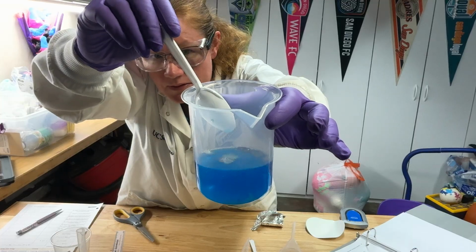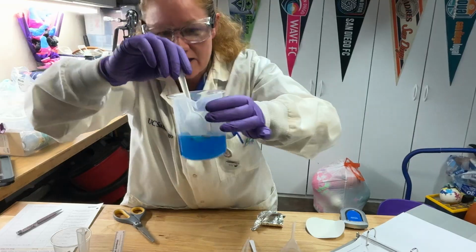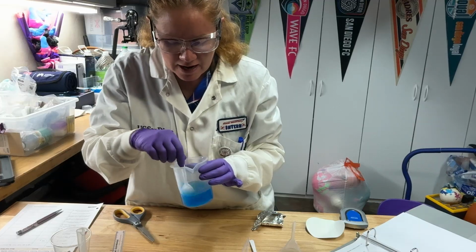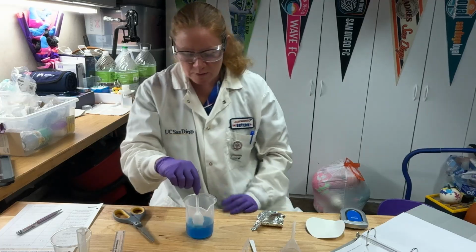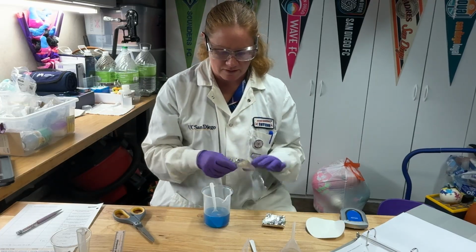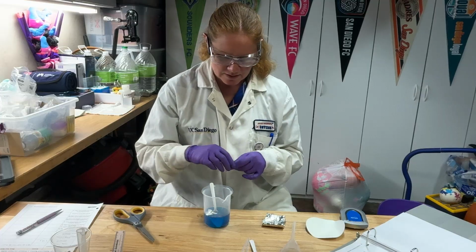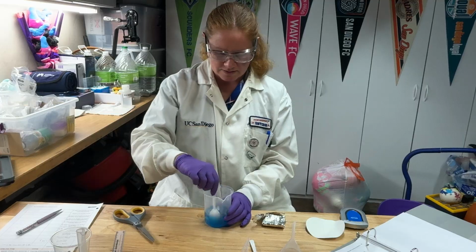So maybe you can see there. You're starting to get a little bit of bubbling, a little bit of fizzing, okay? As it's going, you'll start seeing the copper color form on the surface of the aluminum. And then as you stir it around, that'll go into solution. The aluminum will disappear and you will end up with your copper. All right, so I'm just gonna keep adding slowly until we get that aluminum to dissolve and that copper to come out of solution.